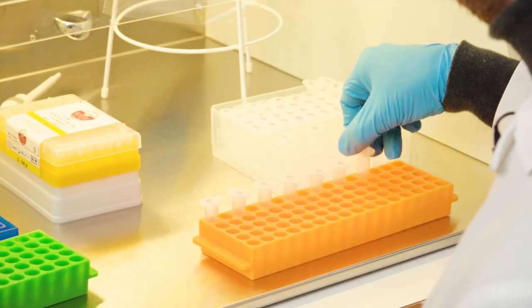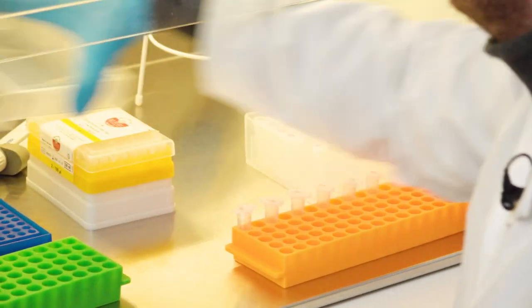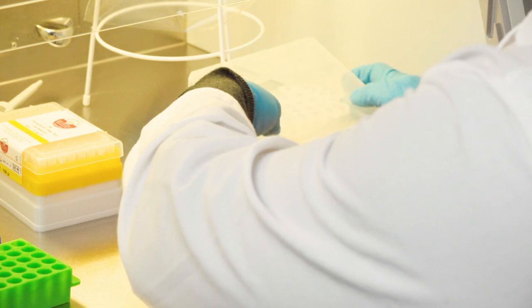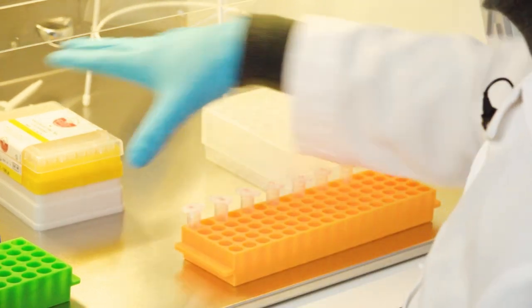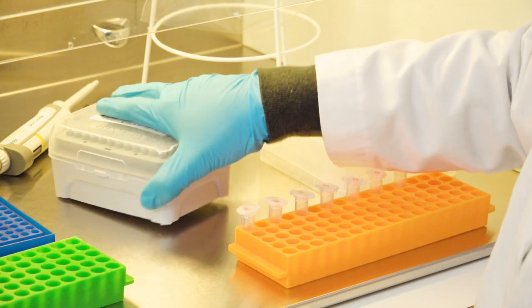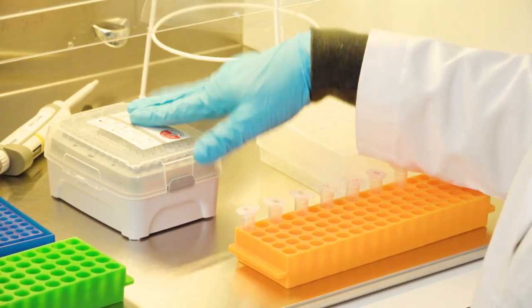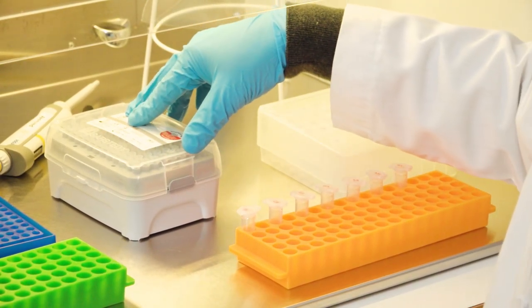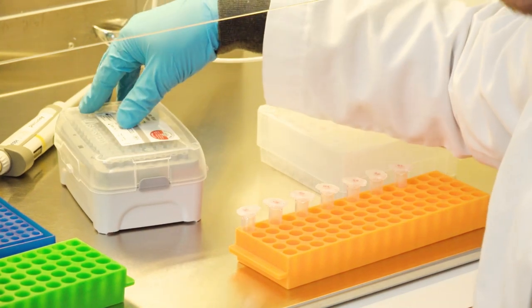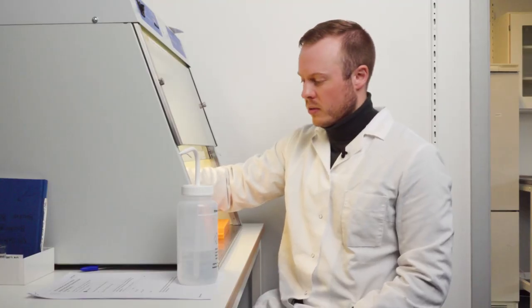Now I've taken some samples here, and I just close them down like this, move the 100 microliter tips, and now I take the 10 microliter tips instead. And here we are normally pipetting a volume from one microliter to five microliters.